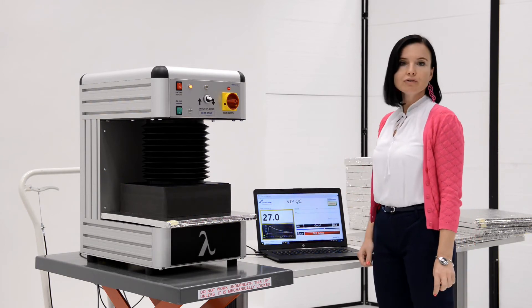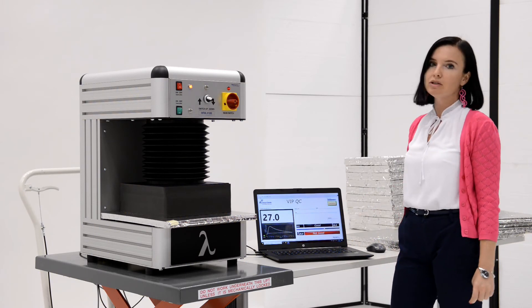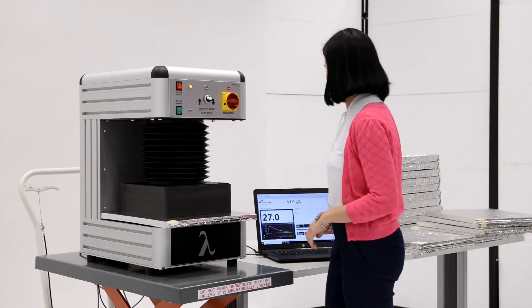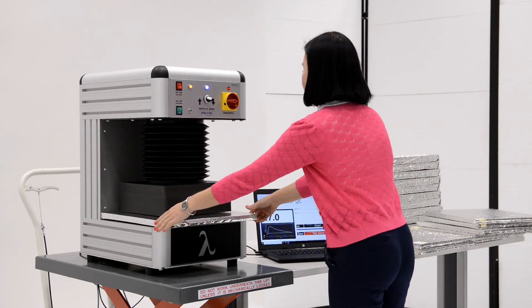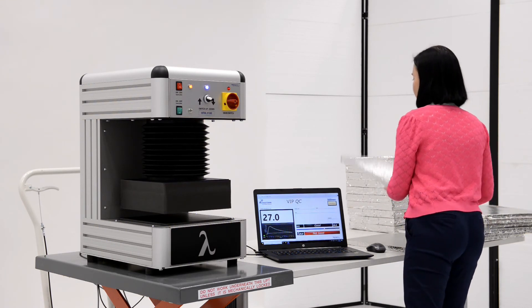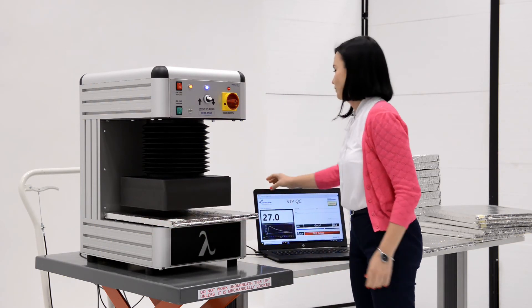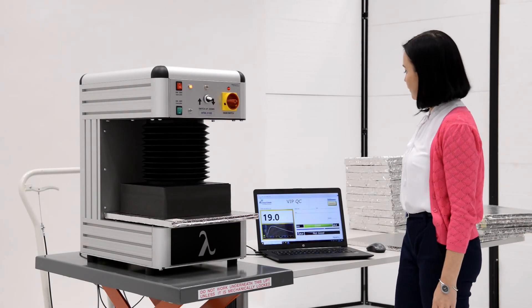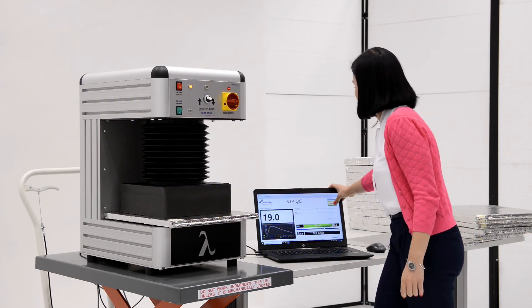The value of 27 is of course bigger than the target 26, which means that the quality of this panel is not good. Then, 19 is lower than 26, so it is marked as good.